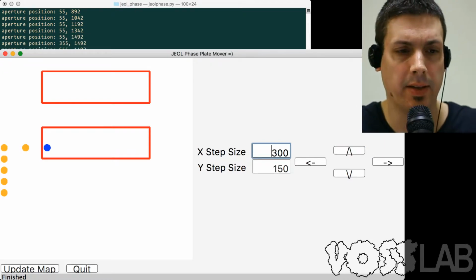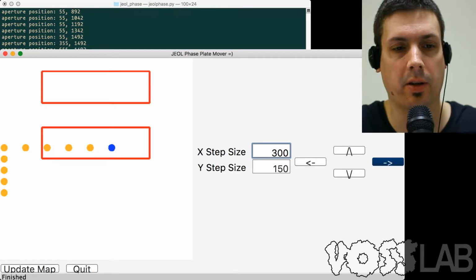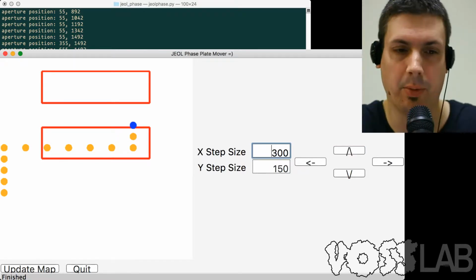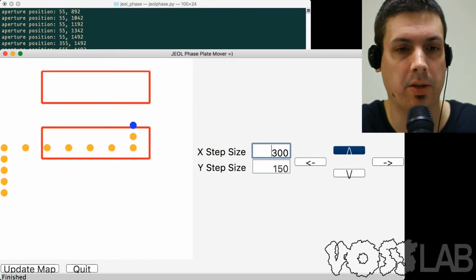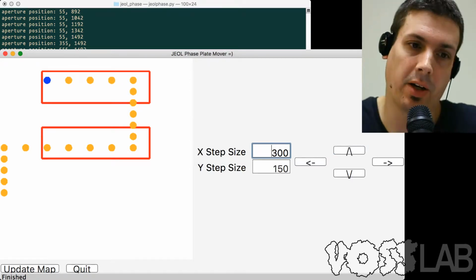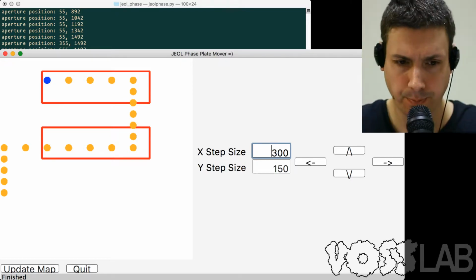As you can see here, we can probably get about 5 steps across for each phase plate using the current parameters. And if you started at a different location, you might be able to fit 3, so maybe 3 by 5, or maybe you can make the step size a little bit tighter. Also, you can use the arrow keys to move from one phase plate location to another, which is fairly convenient. So yeah, it's kind of fun to play around with, at least watch the moving dot around. Orange is the old points and the blue is the new points.